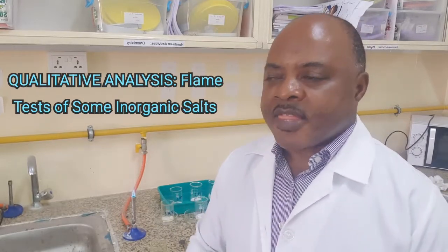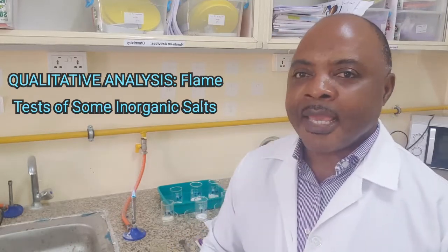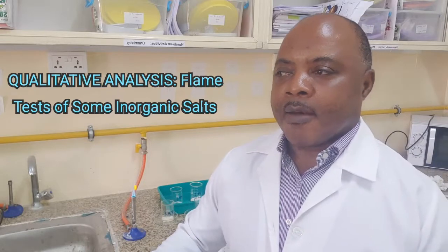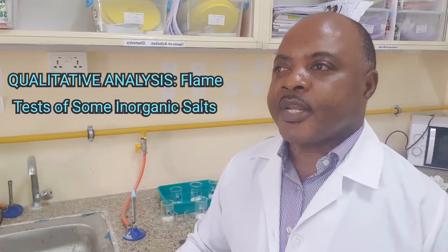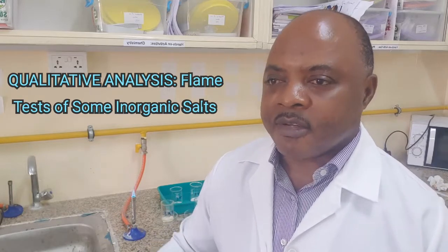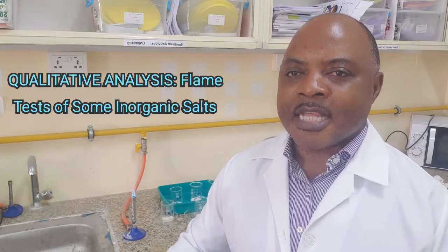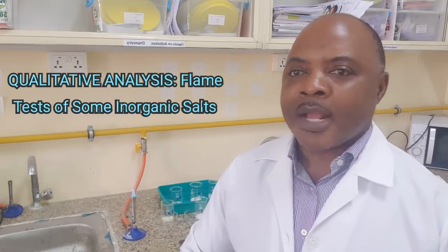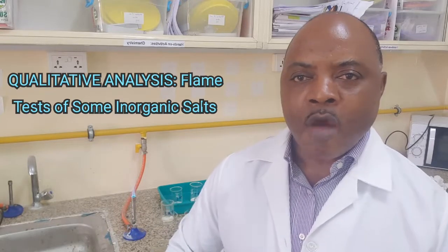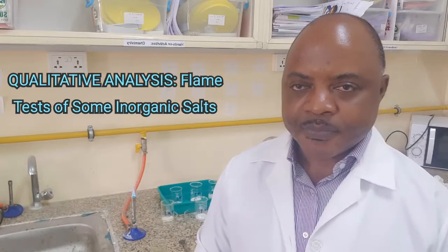So, this is a qualitative analysis, analyzing inorganic salts to determine the cation or the metals that are present in them. And this is a determination test. One way of carrying out this determination test is through a flame test.